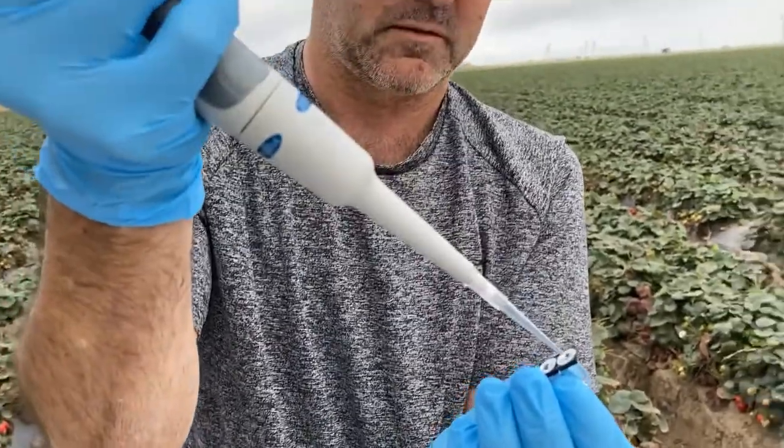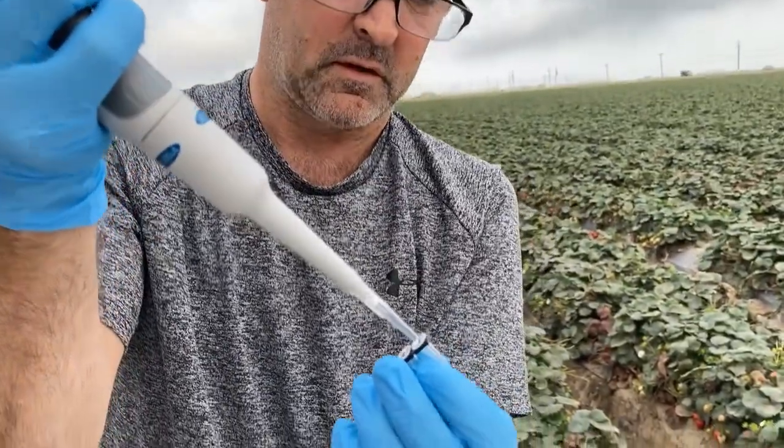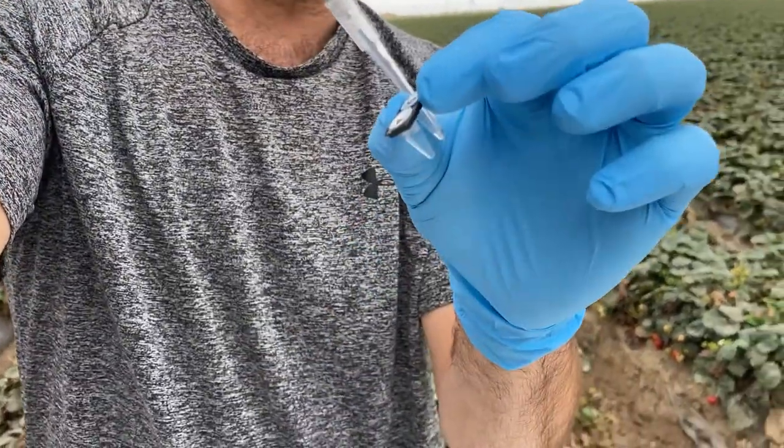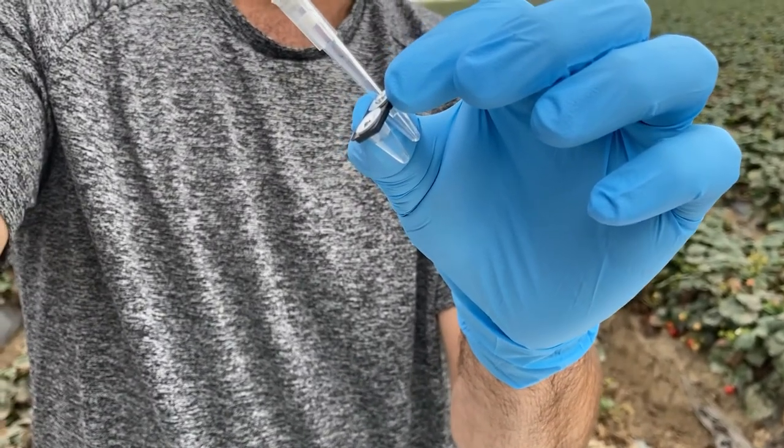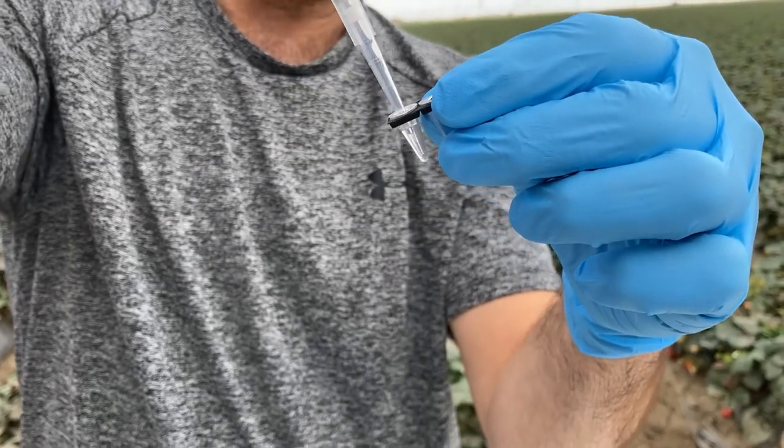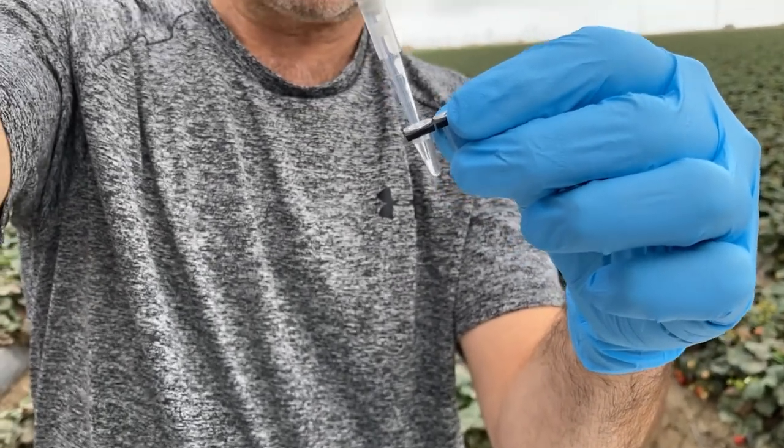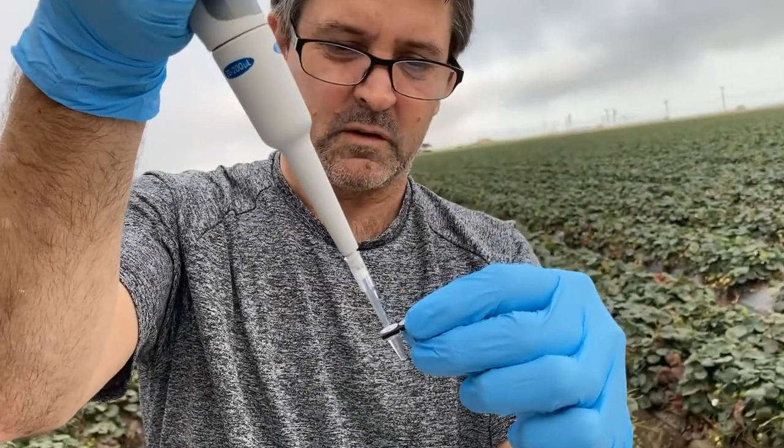Now we're going to mix this without dropping it. Take this sample and go ahead and put it in here and mix that up. And we want 30 of this to go in the same sample port where the pore is at.